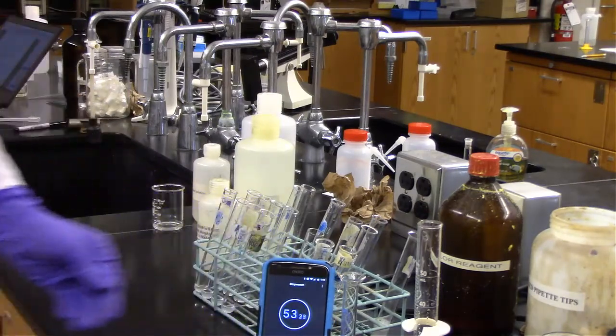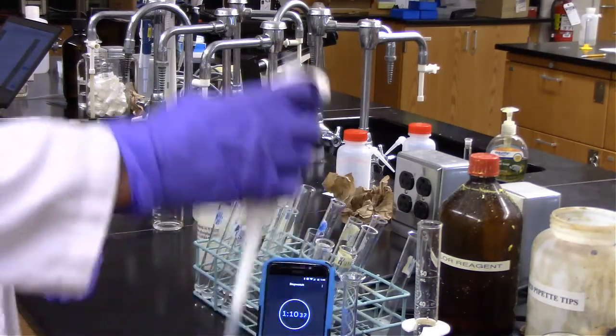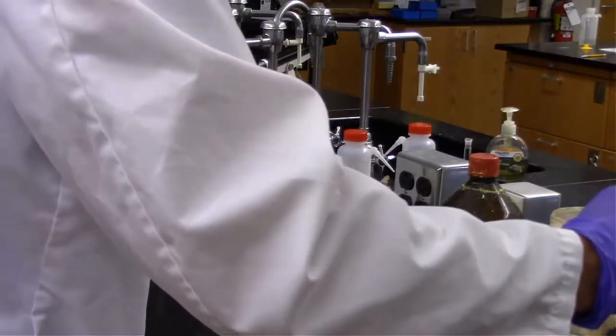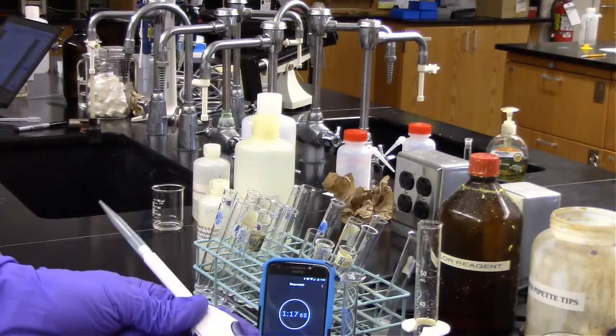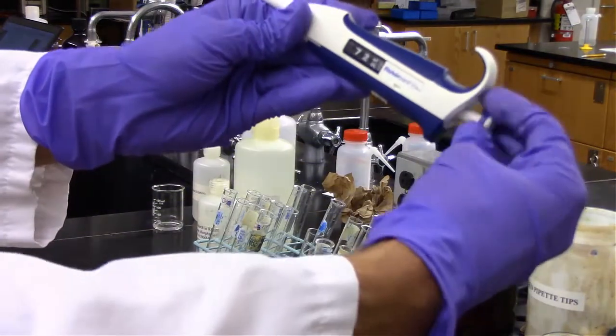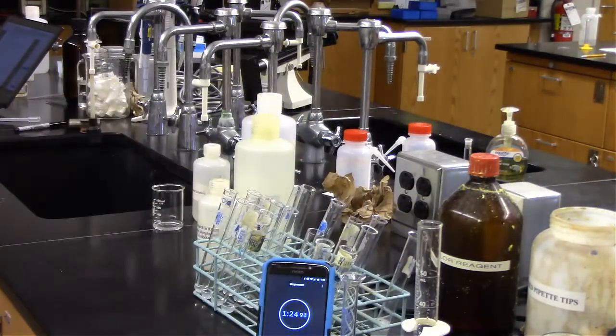So right now in the experiment, what's happening is my saliva is working hard, specifically the alpha-Amylase in my saliva is doing everything it can to break down that starch into maltose equivalent, maltose or glucose equivalent. So essentially the more of that starch polymer that's broken, the more potential there is for the sugars that I'm making to reduce the color reagent, that dinitrosalicylic acid.